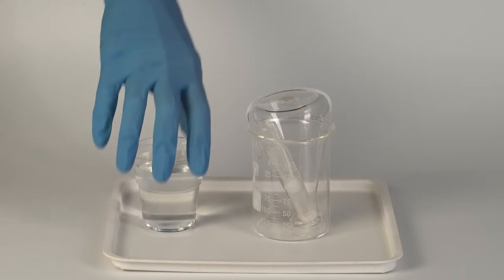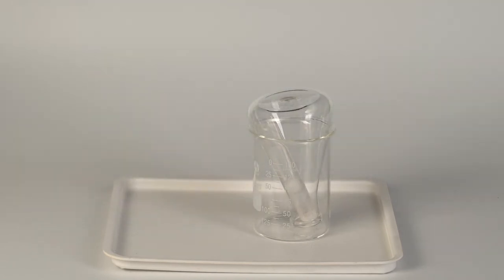In the test tube, calcium oxide reacts with water, forming calcium hydroxide and heat. The calcium hydroxide then reacts with the ammonium chloride. This results in the formation of ammonia, which accumulates in the flask.